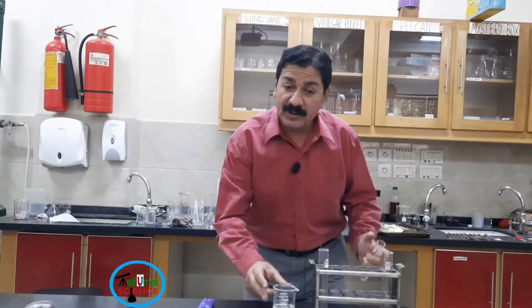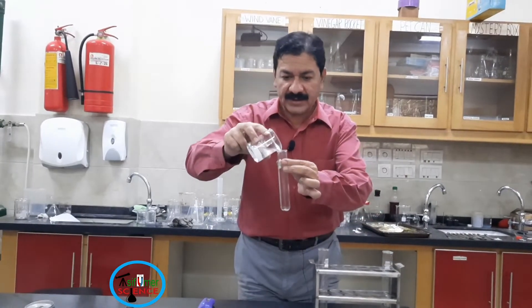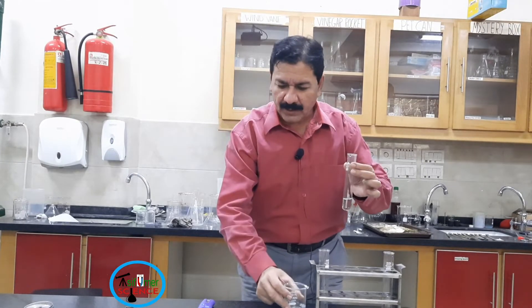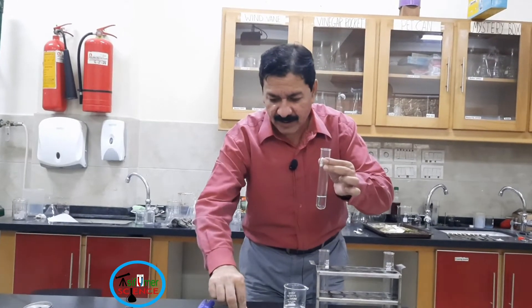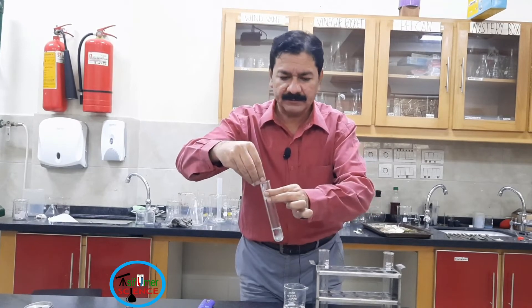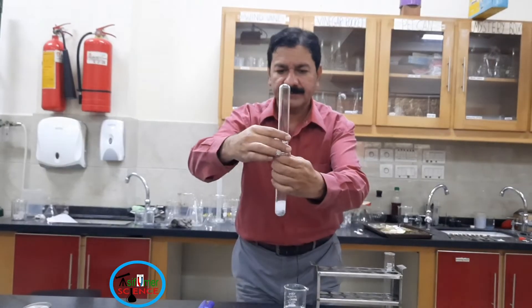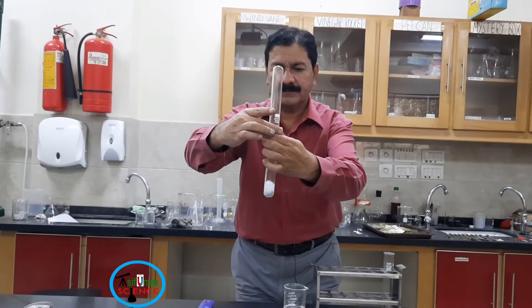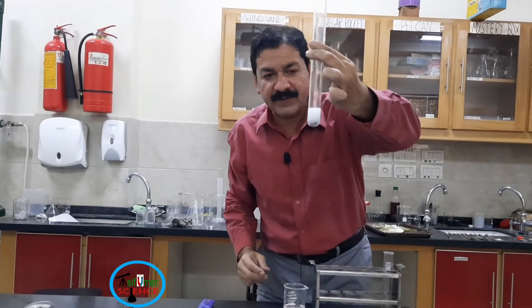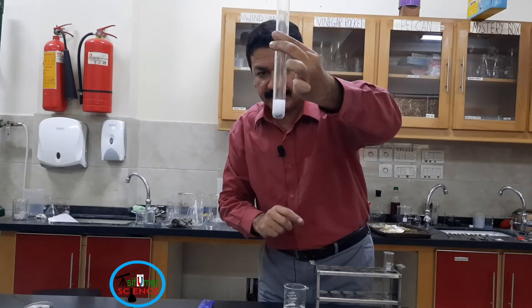I am going to use the same acid, approximately 10 ml, but a different metal. Now I am using zinc metal with the same procedure. The reaction is not very fast, and you can see a cloudy color.